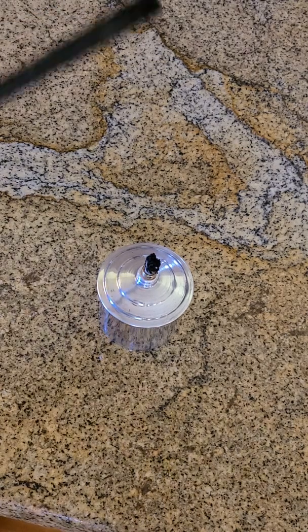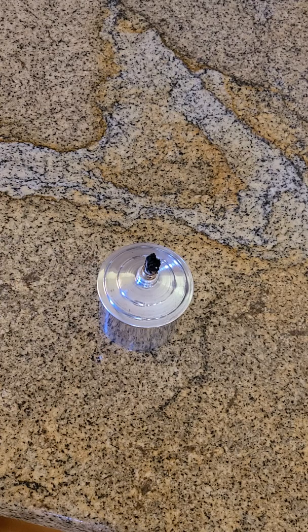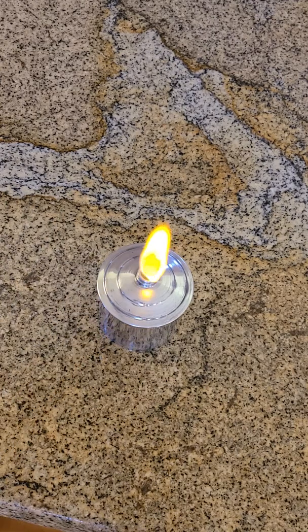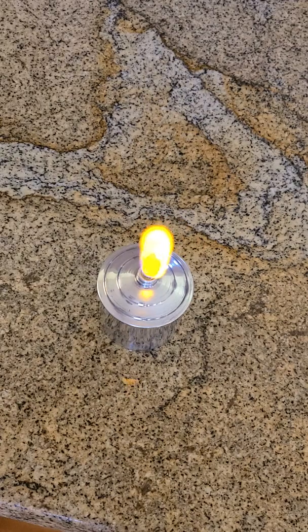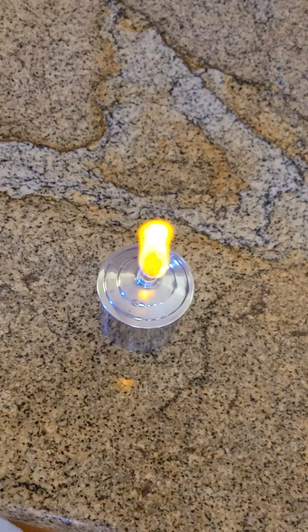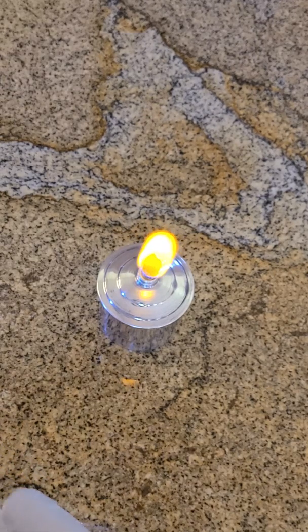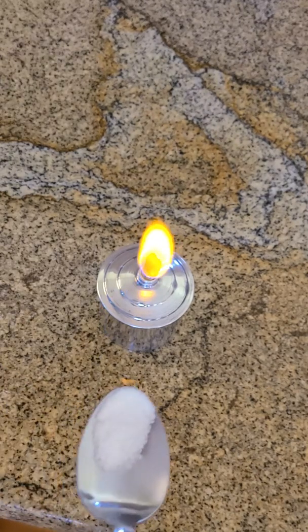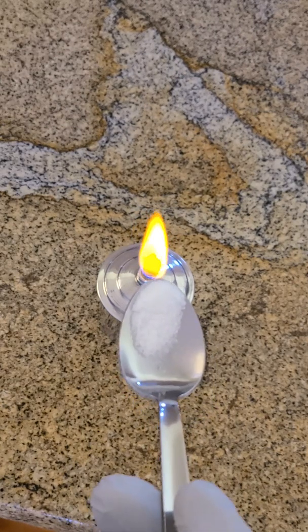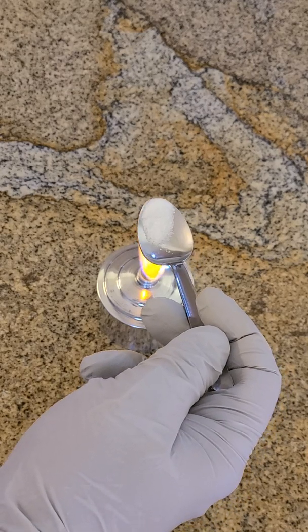So in this particular video, we have our alcohol burner that we added the alcohol to, and I'm going to go ahead and light the wick. You can take any spoon around your house and use the sugar on your little tiny tablespoon, and you're going to go ahead and burn that and see what happens.